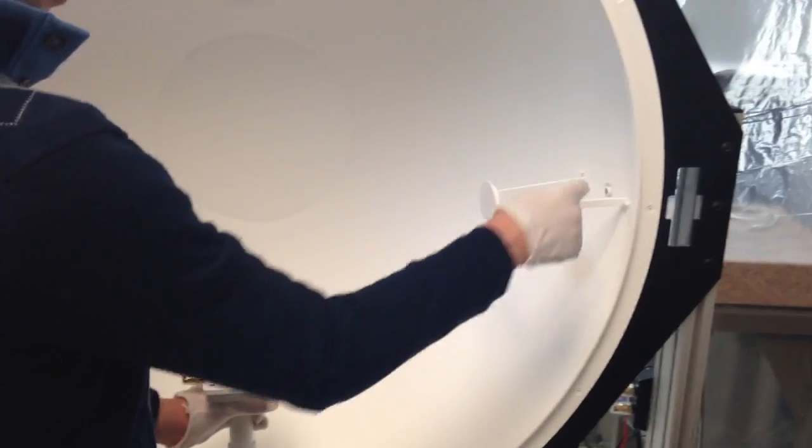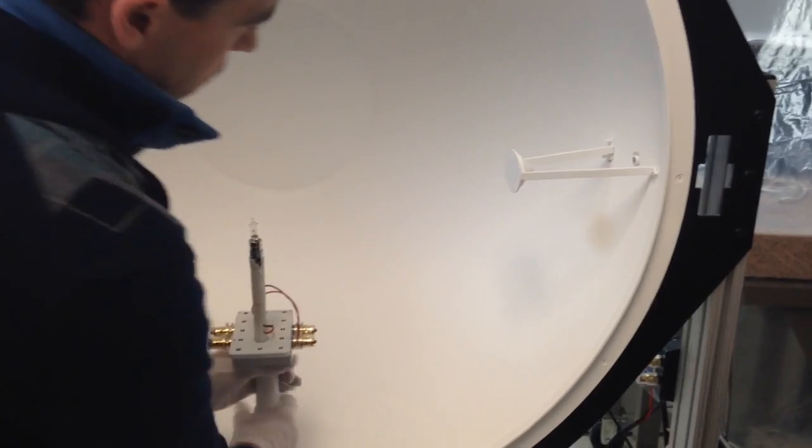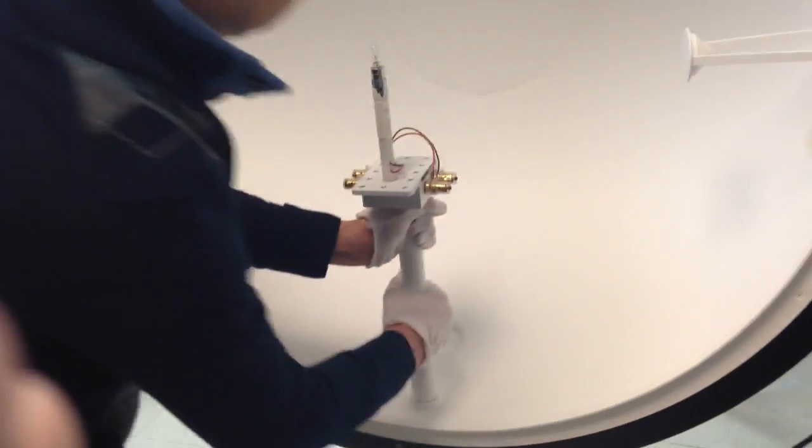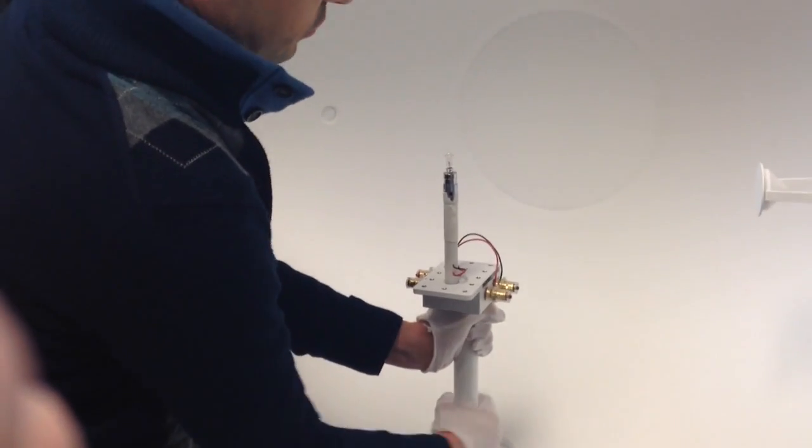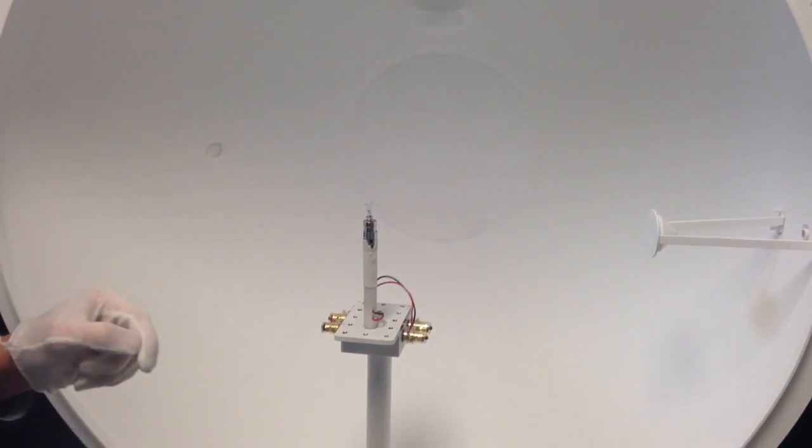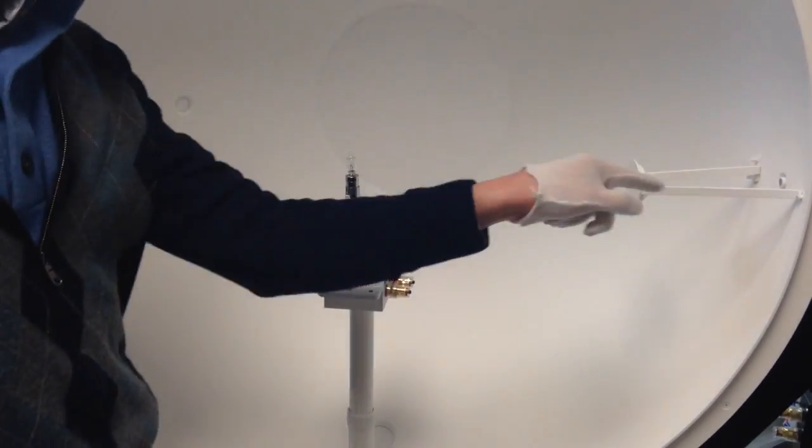It'll cast a shadow of the baffle over the detector. And what you want to do is have that detector in the center of the shadow, which we don't have a lamp on right now, but that'll give you the right position for the calibration lamp. And it's easy as that.